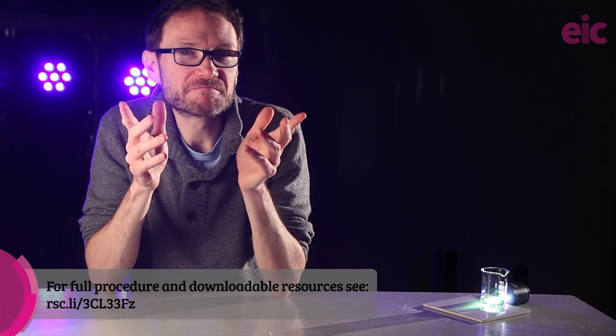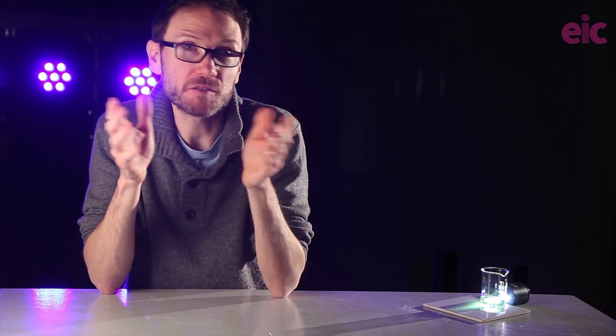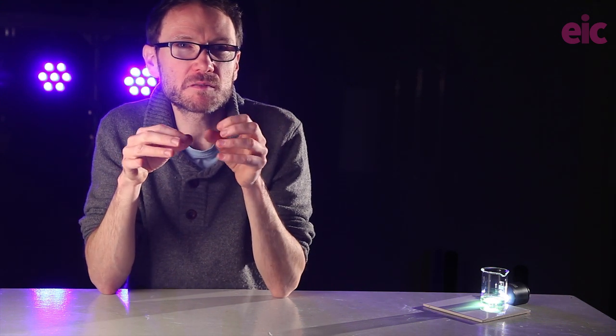So, where to begin? If you're an CLEAPSS member, you'll start by checking out the recipe book for producing a solution of ammonium metavanadate 5. This is a 0.1 mole per decimeter cubed solution in sulfuric acid, and it's the one that you're going to find most commonly in other literature as well. Do note the safety protocols in position here.